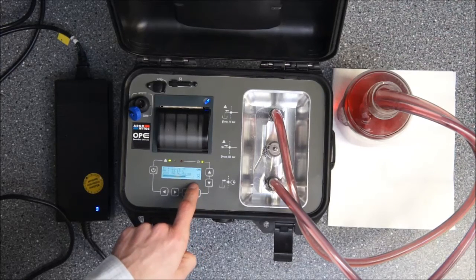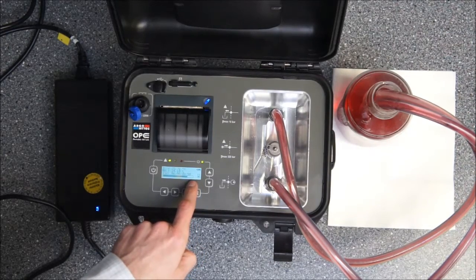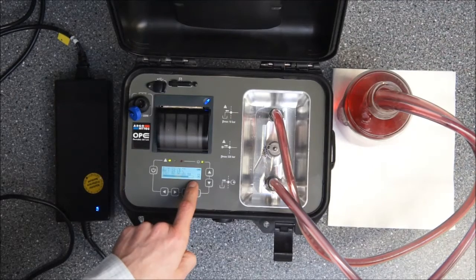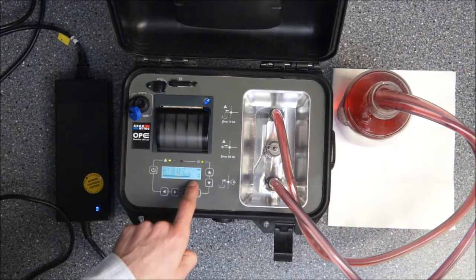In the right upper corner you see a sign for the battery that is just showing the current charge of the battery, which is fully charged.